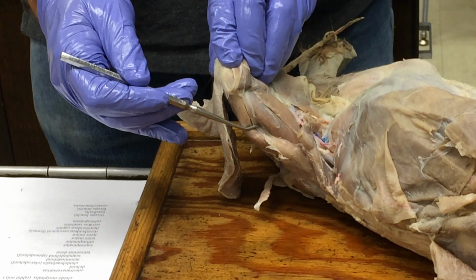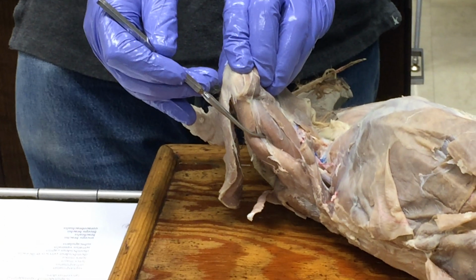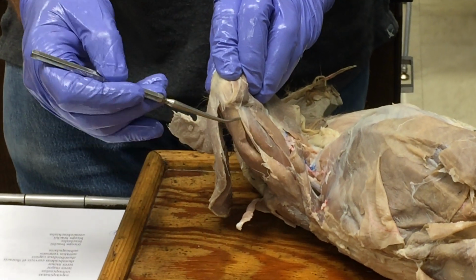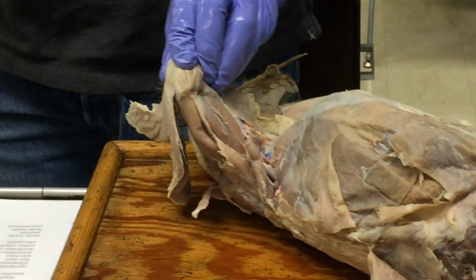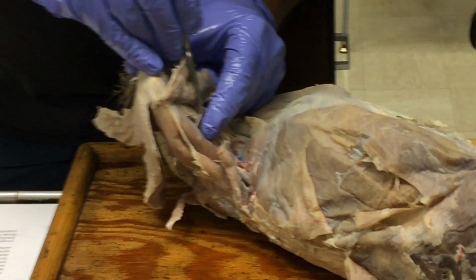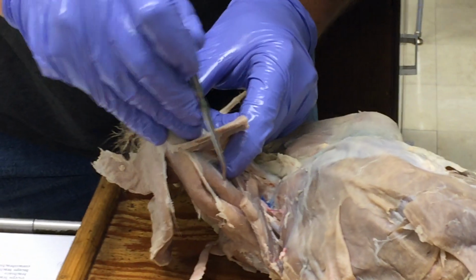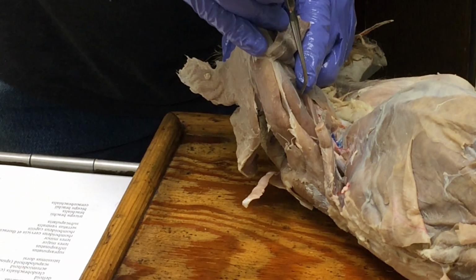Vastus lateralis. No, intermediate. We got all kinds of ideas. It's not one of the vasti. Rectus. Oh, femoris. That's the rectus femoris, yeah, which literally means straight muscle of the thigh, because it's running straight down the front of the thigh. So that's the rectus femoris. And then to find the vastus intermedius, you have to look underneath rectus femoris. And we can see it actually from the medial side here. Do you see that? That's vastus intermedius.